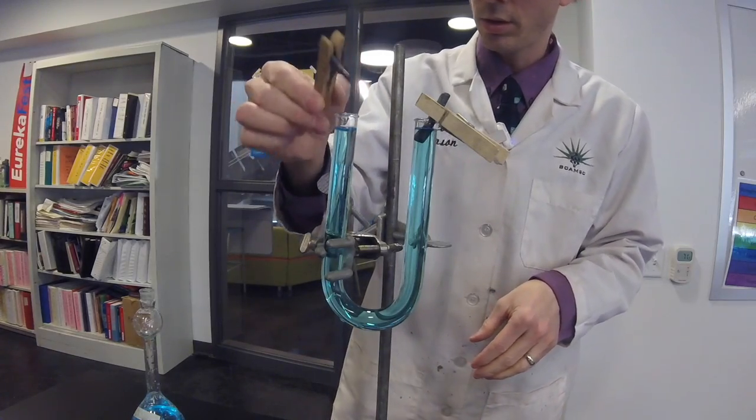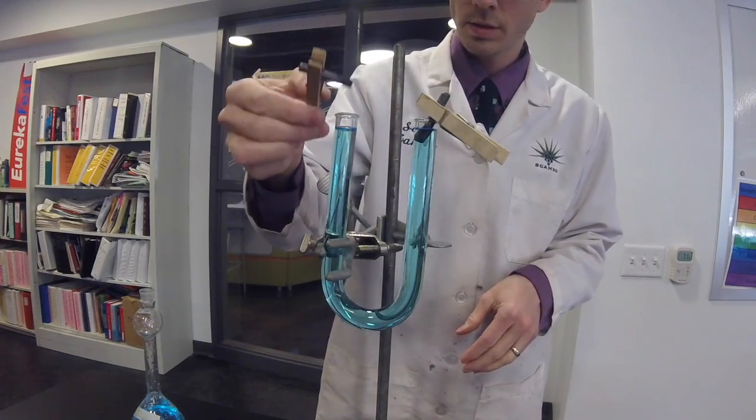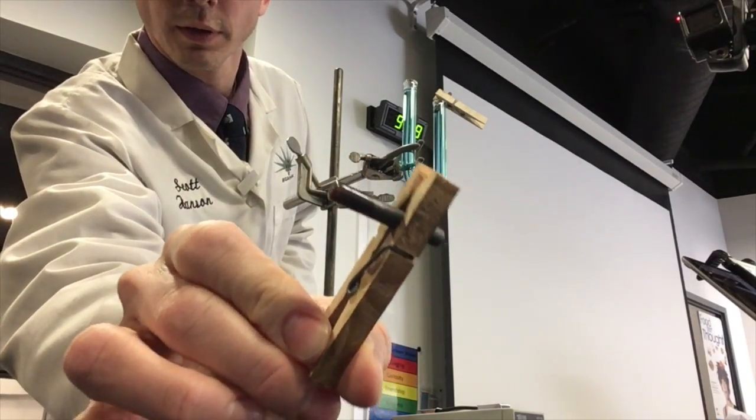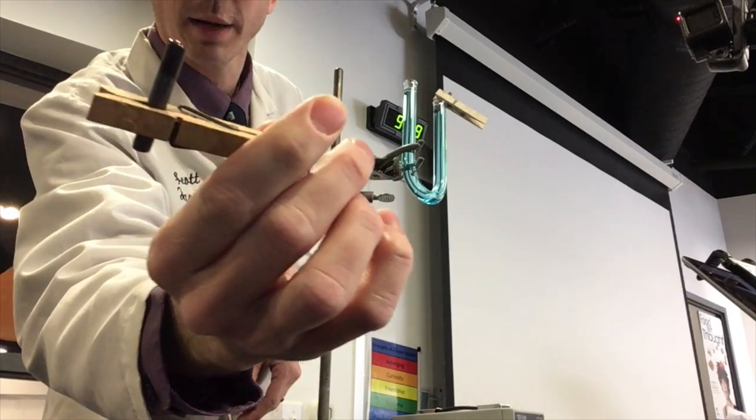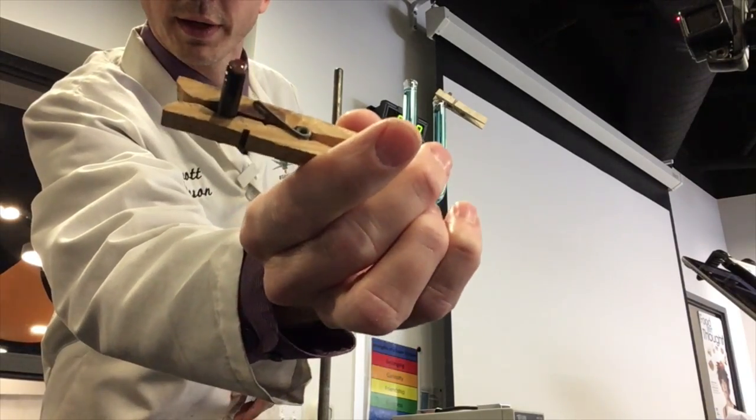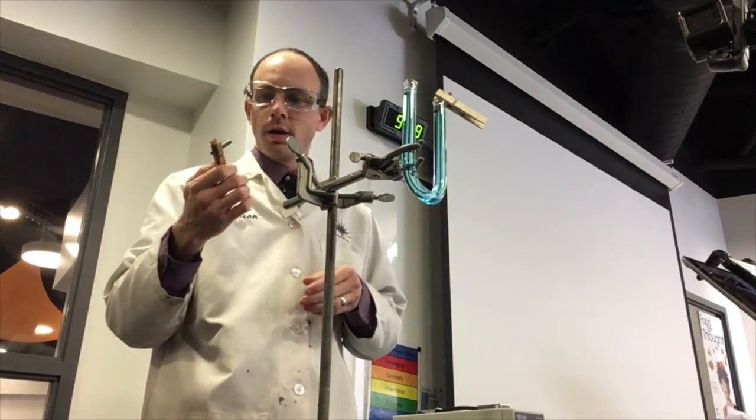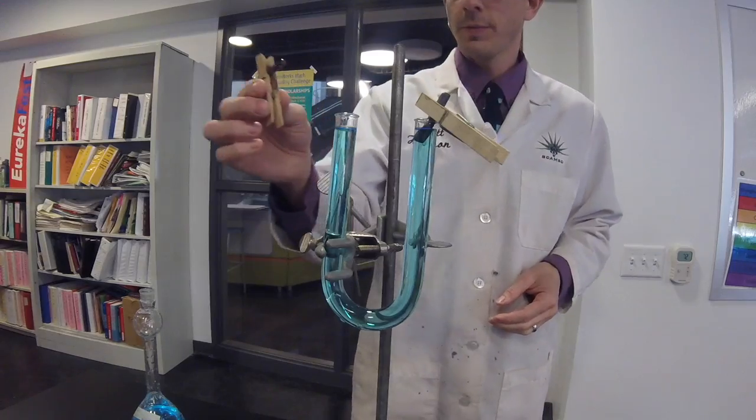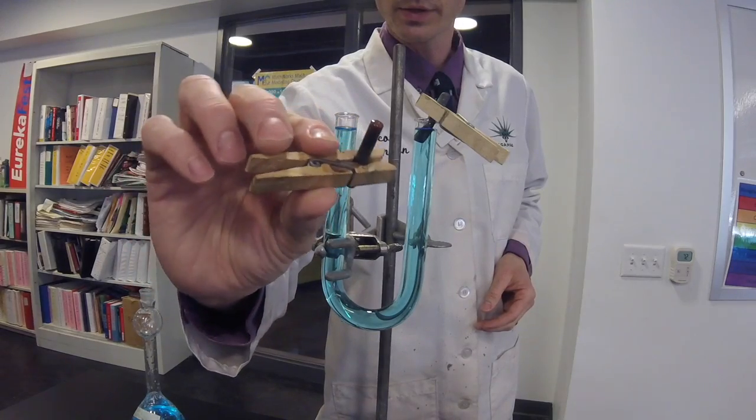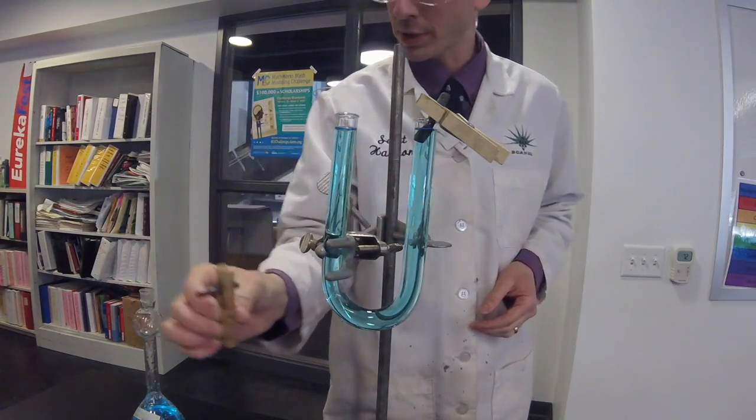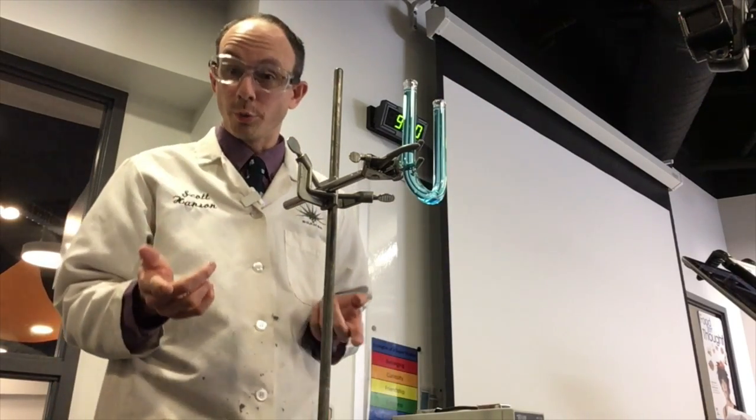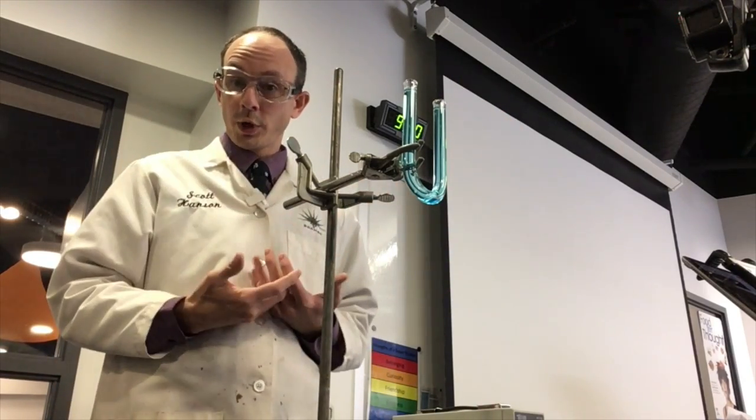And now let's take a look. There's some copper, nice copper starting to form on the end of that, looks a little shiny, it's hard to see with the glare and the light. Let's see if we can get it better on this one. You got some copper starting to form. So was your prediction correct or were you backwards?